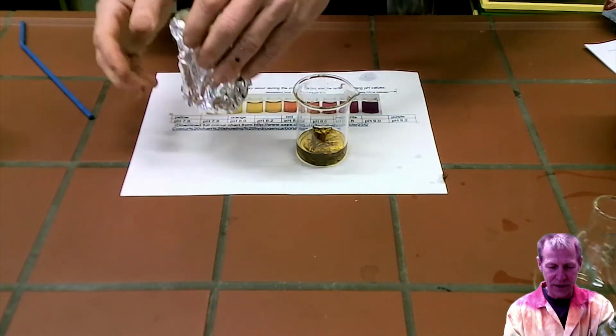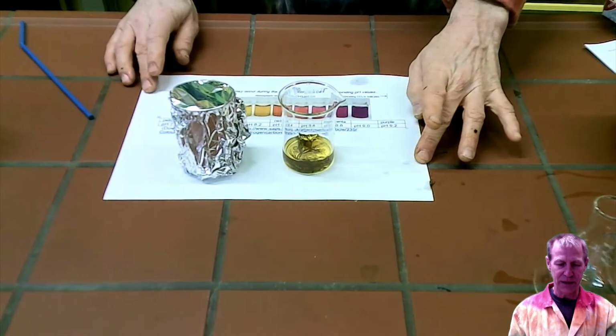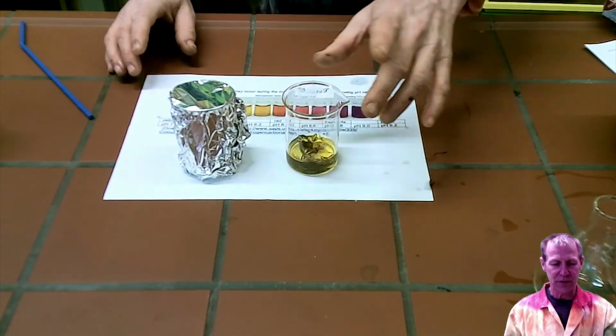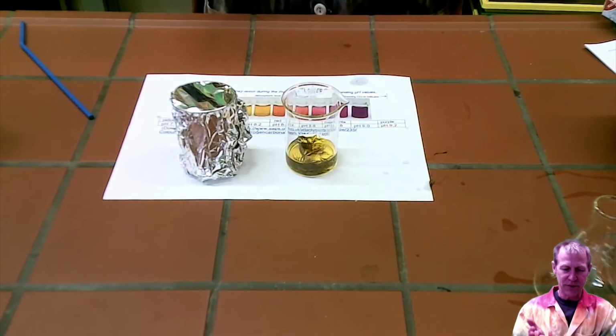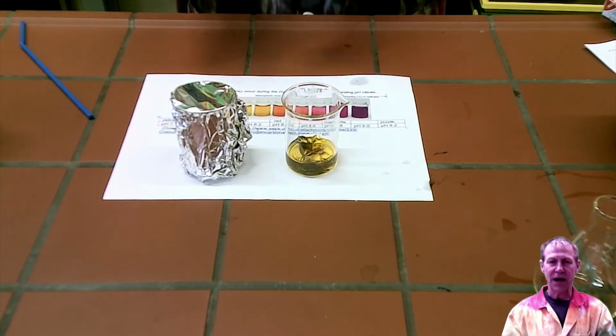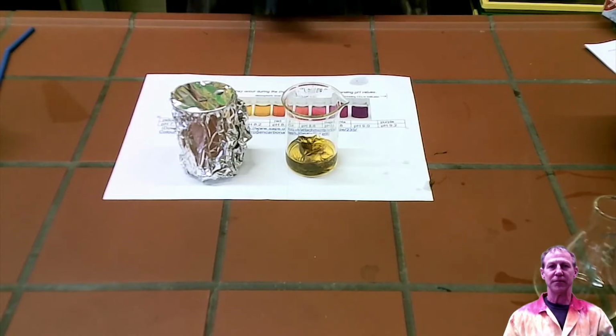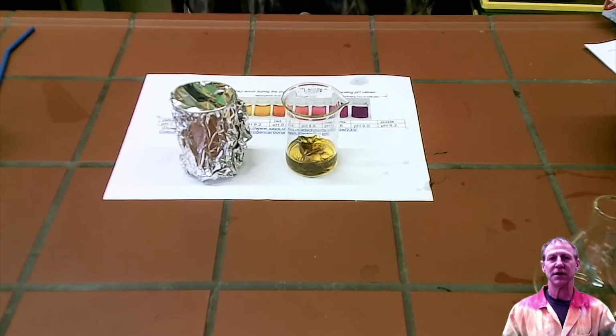Ideally, I should have a plant light, so I might get a plant light, and I will leave these here and come back and take a measurement every 10 to 15 minutes. So that'll be a time-lapse part of this experiment. And then we'll come to the end and we'll wrap this up and discuss some possibilities of the results.